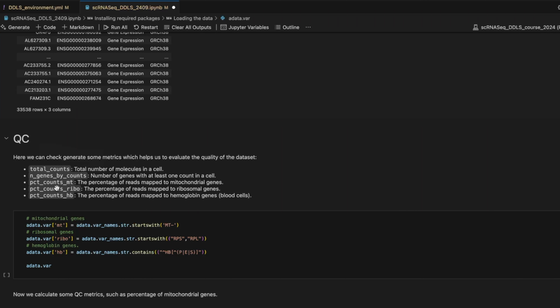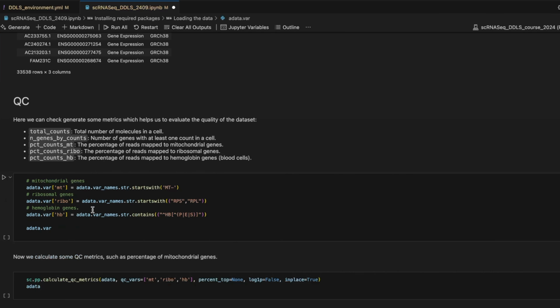There are given metrics that we can generate, for example, total count, which tells us the total number of molecules in a cell, and genes by count, which refers to the number of genes with at least one count in a cell, in a way showing us the expression level. We also calculate the percentage of mitochondrial genes, ribosomal genes, and hemoglobin genes, referring to blood cells.